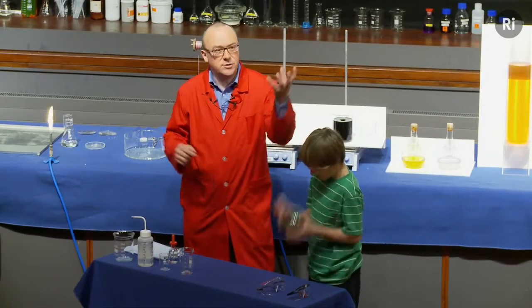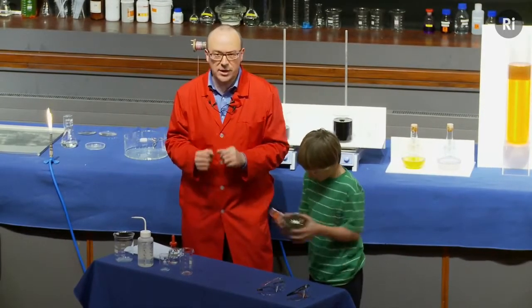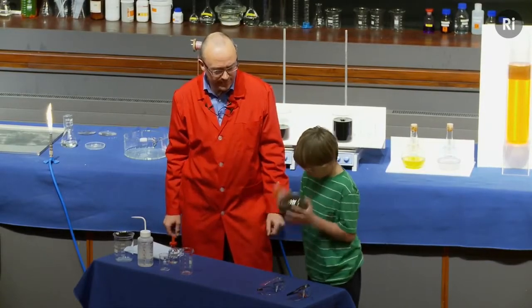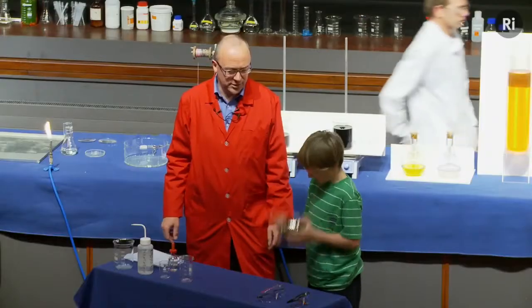You'll all have seen those decorations that you get at Christmas, those spheres that are shiny, and they're made using this chemical reaction. The little balls of glass, and the inside is coated with silver using this kind of chemistry. Doing really well. Okay, let's just have a quick look. Almost there. Keep going a little bit longer. Still looking a little bit dark.